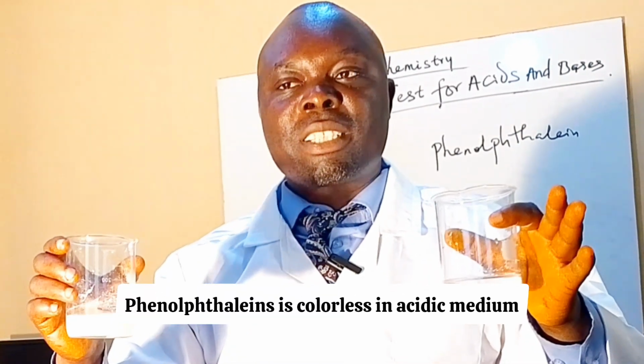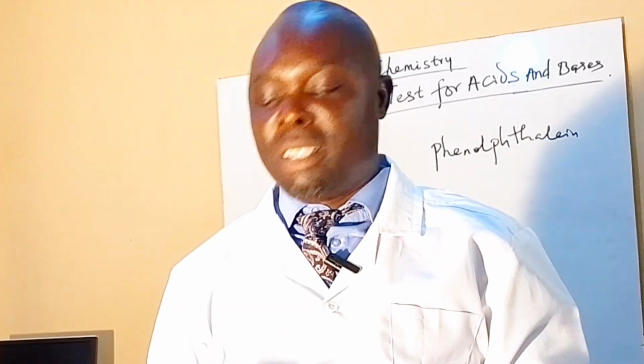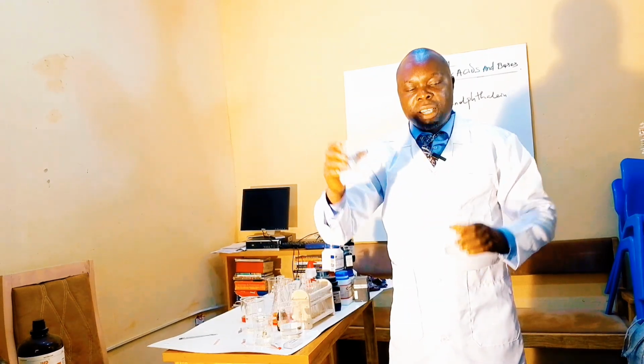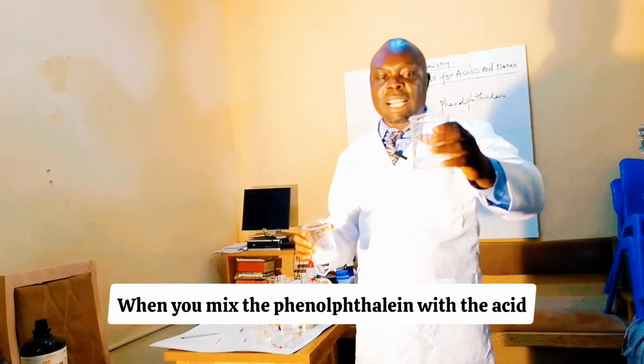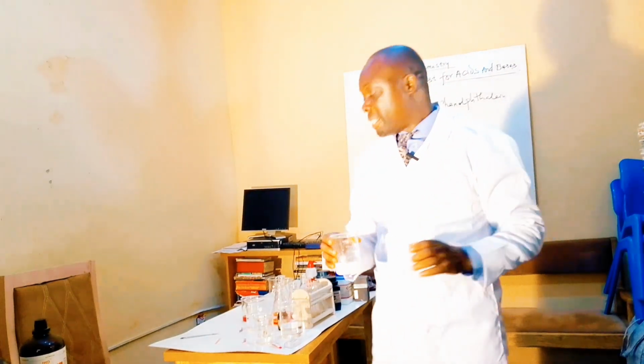Phenolphthalein is colorless in acidic medium. The color of phenolphthalein is colorless. It has no color. The acid too has no color. When you mix the phenolphthalein with the acid, the color still remains colorless.